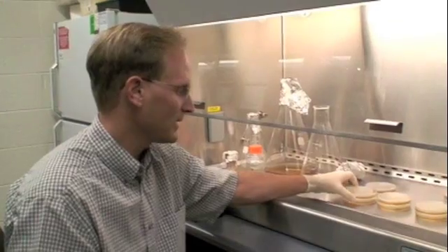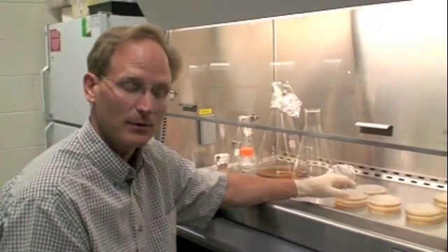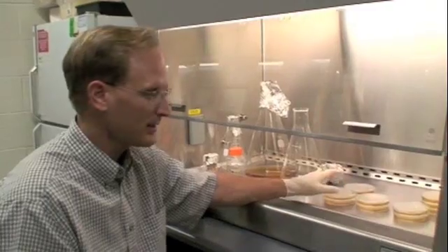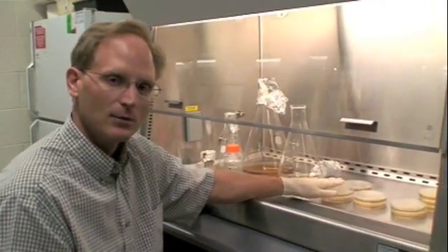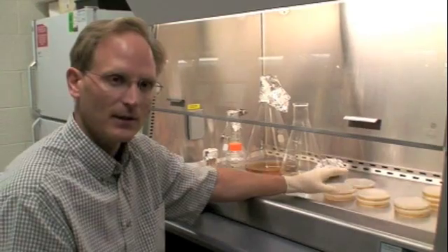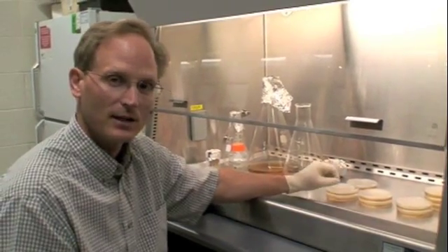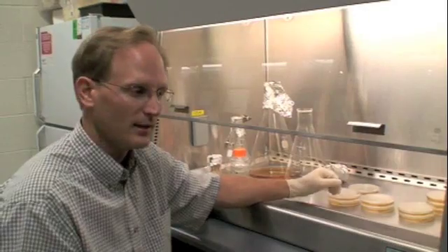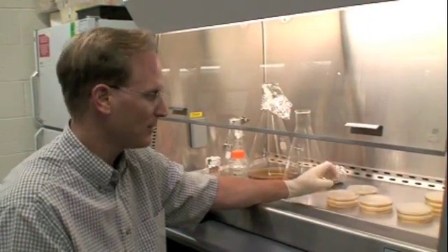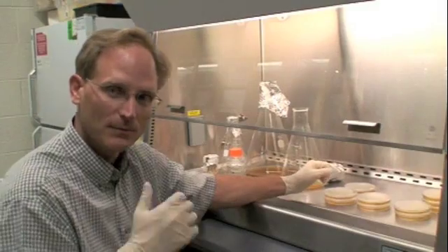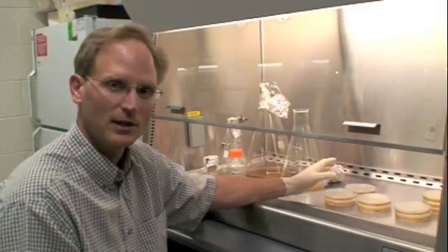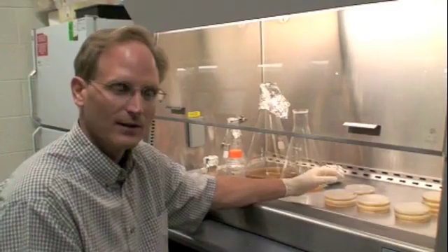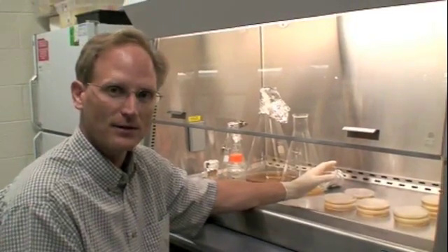The bacteria will grow best when the plates are pre-warmed. So we're going to stick them back, after they've hardened, we'll stick them in the incubator for a little bit before we actually put the cells on there. And it won't shock the bacteria. If you take cold plates right out of the fridge, put bacteria on it, you'll shock the cells and you won't have very good growth results coming out of it.